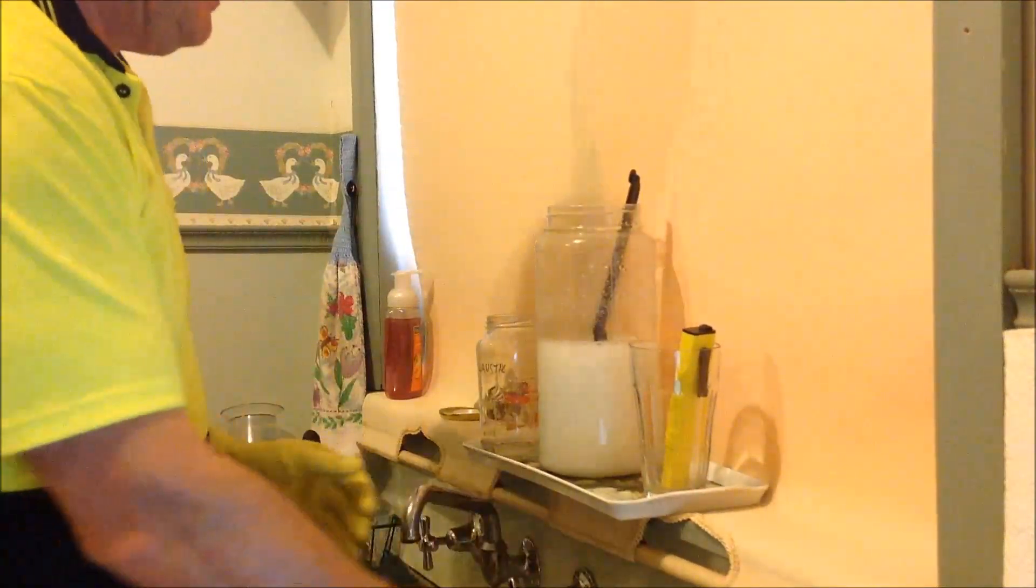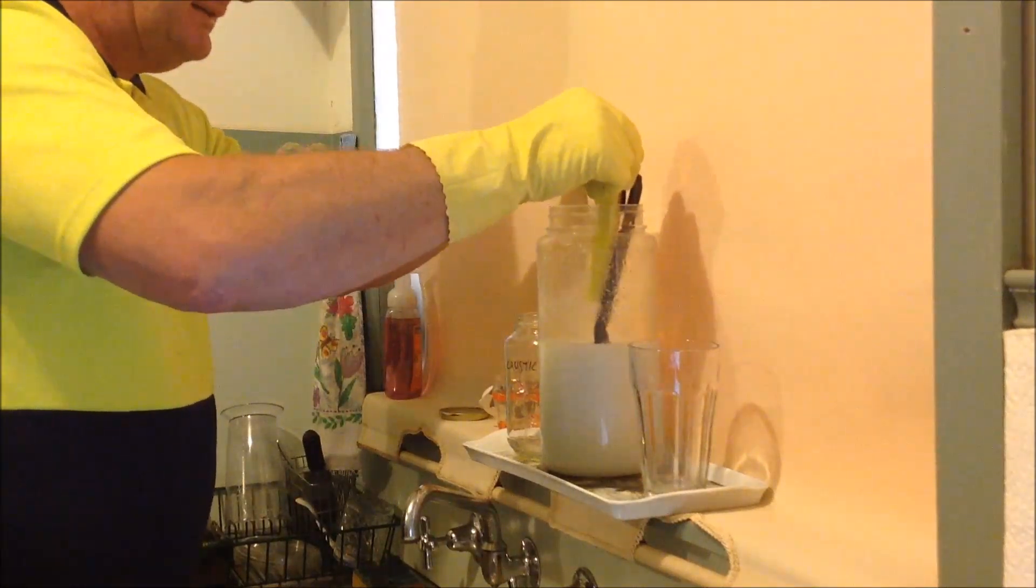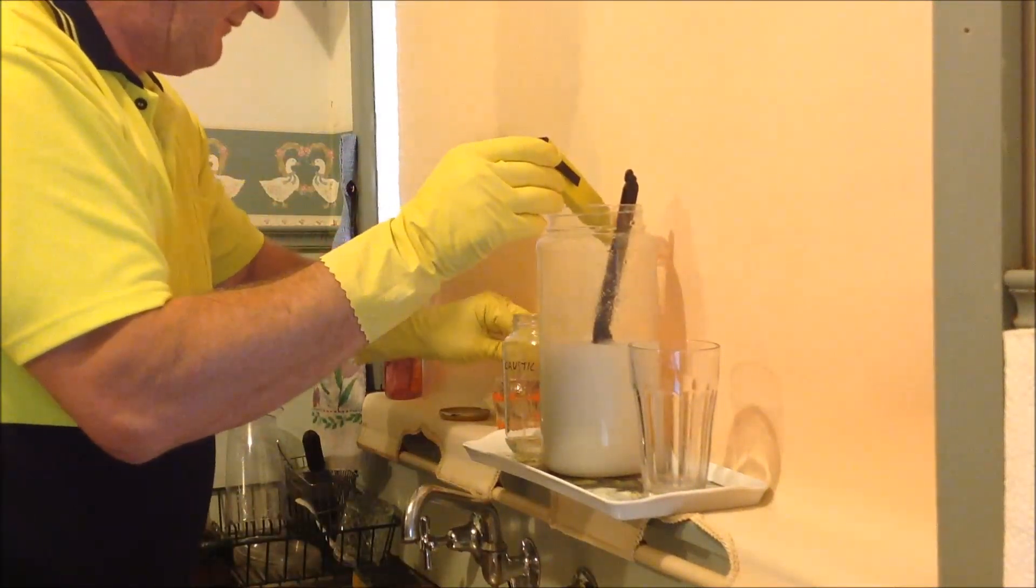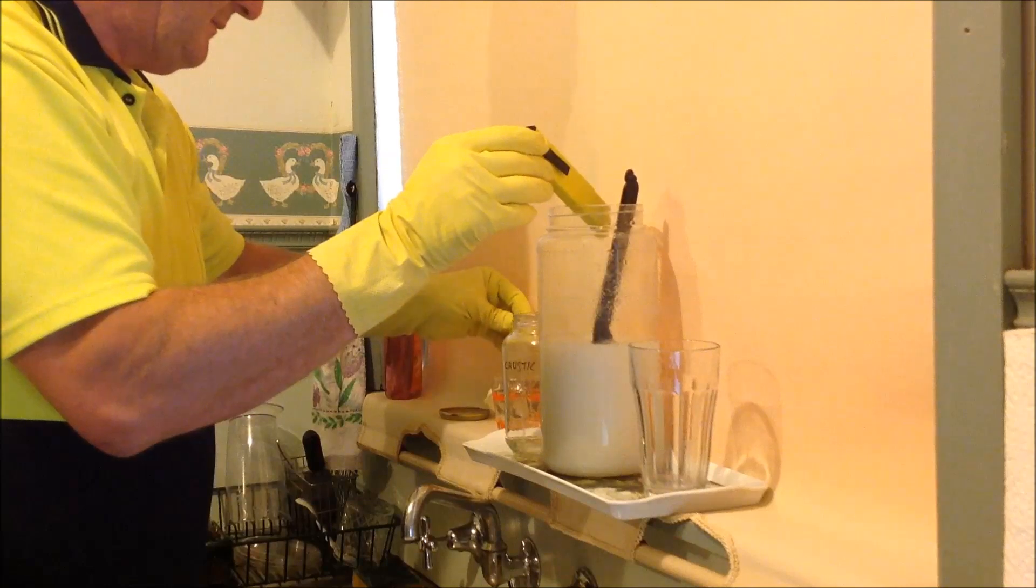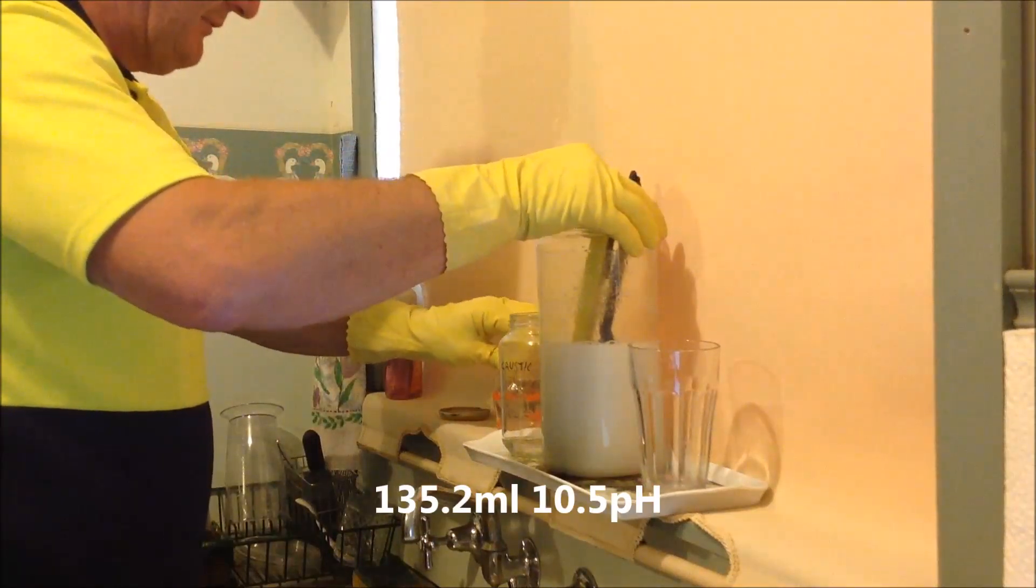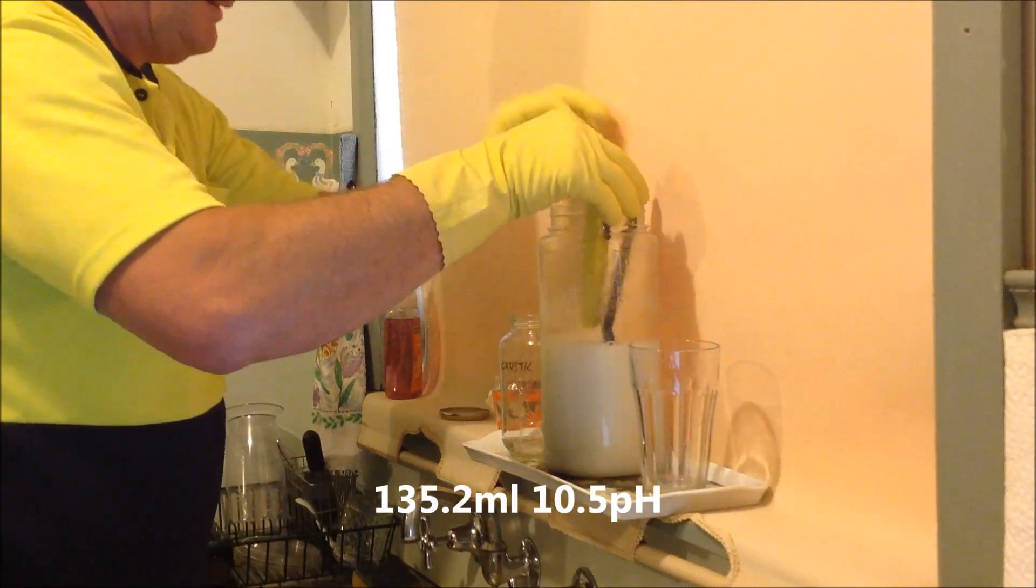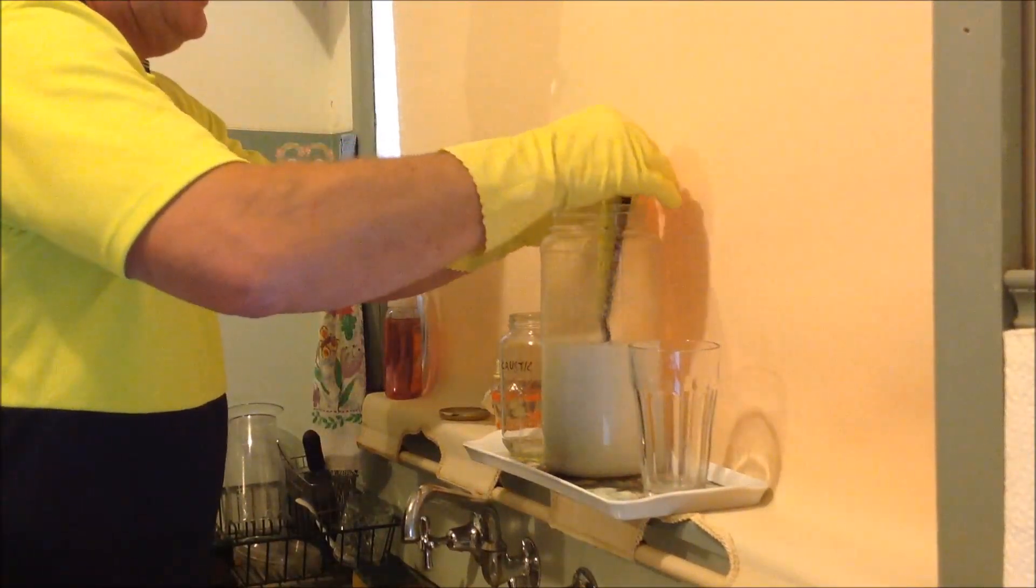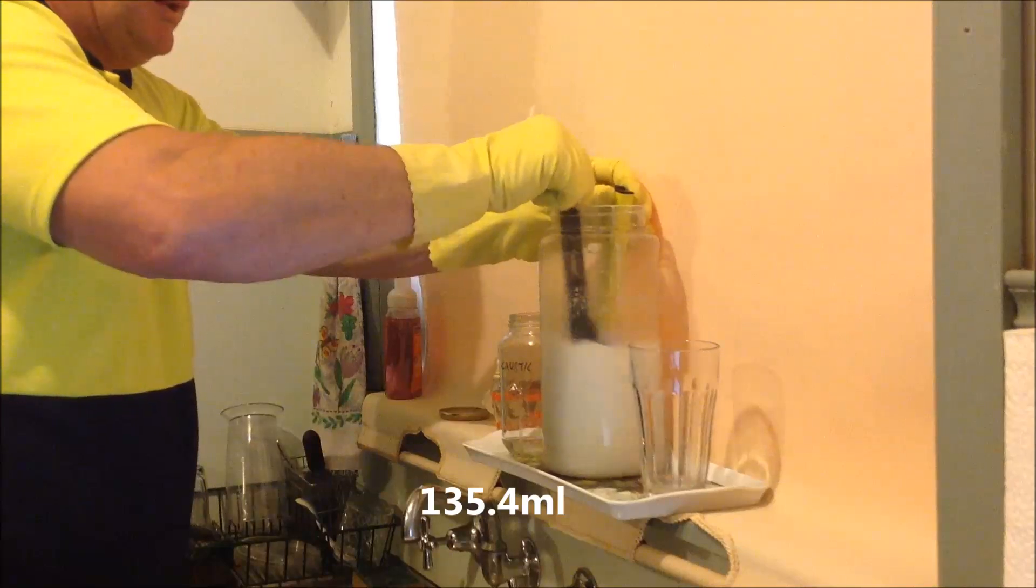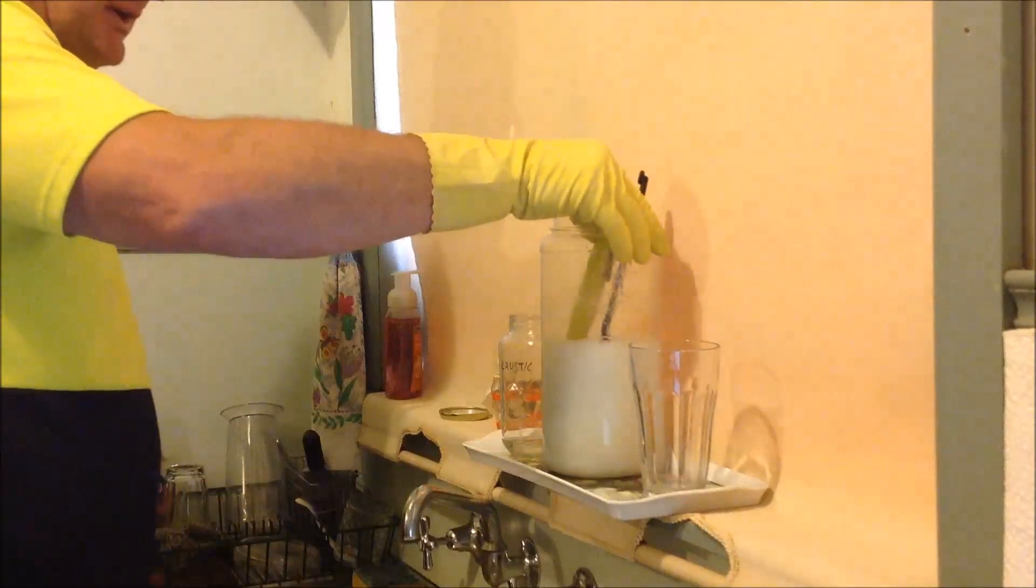Going to stop with that one now. Feel like that's 1ml, remember this is 0.1 of the other. 10.6, fluctuating down to 10.5. I'll put another whole ml in, so now I'm up to 0.2, that's stable on 10.5. Put another 2 I think in, so now I'm up to 0.4. You often find this, that reactions will go one way or the other. When you get towards the end, they may accelerate and try to go past your end point.